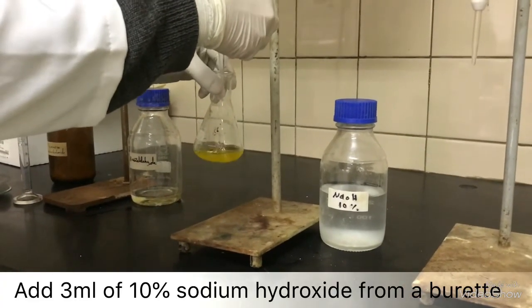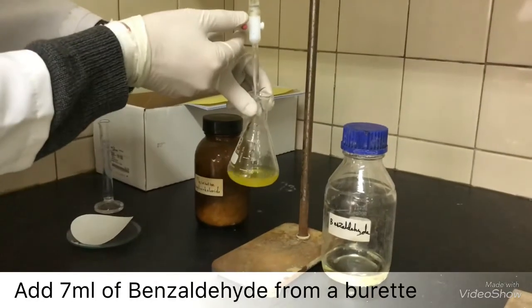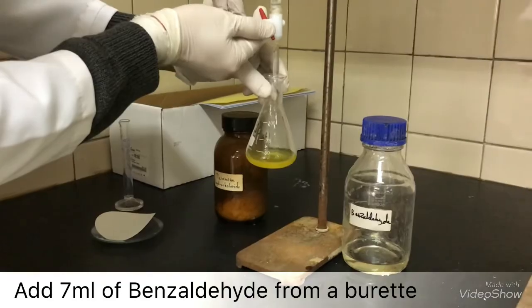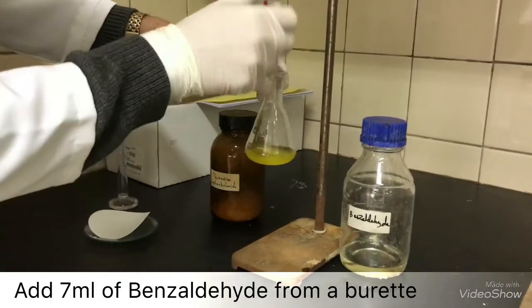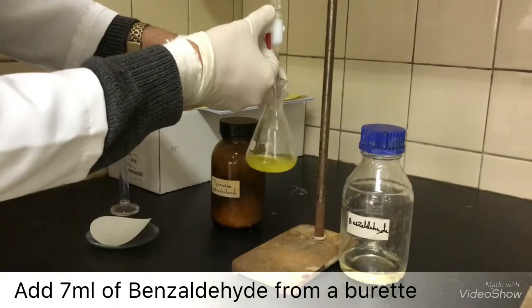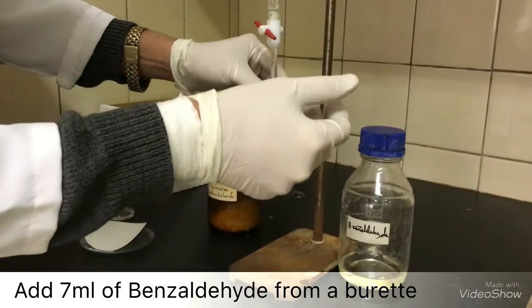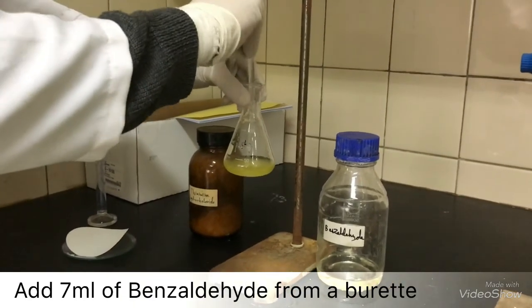Shake well. And finally, 7 ml of benzaldehyde. Make sure to mix between each addition.